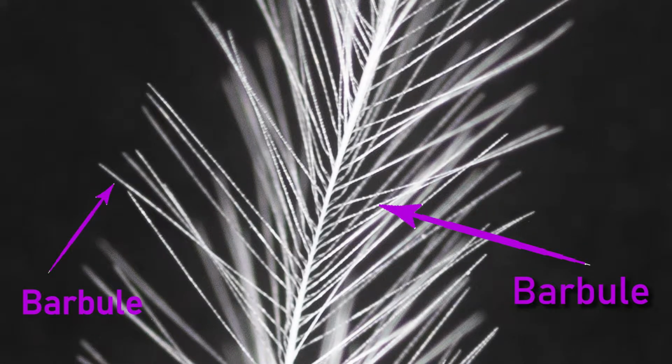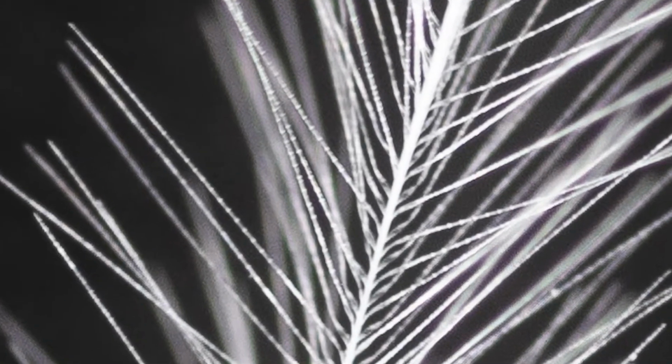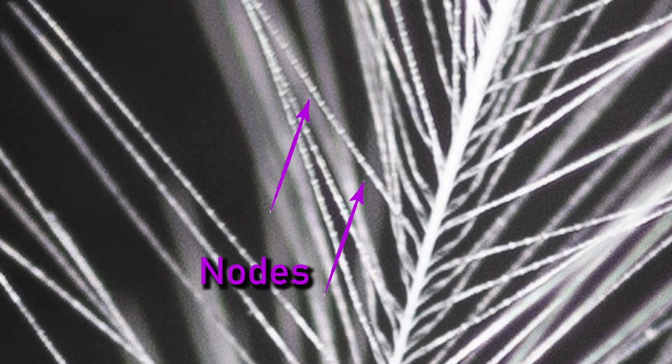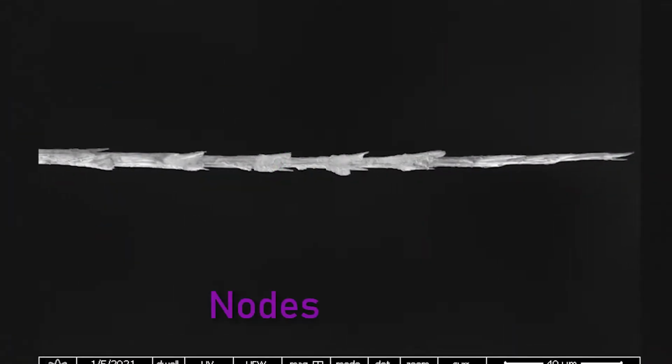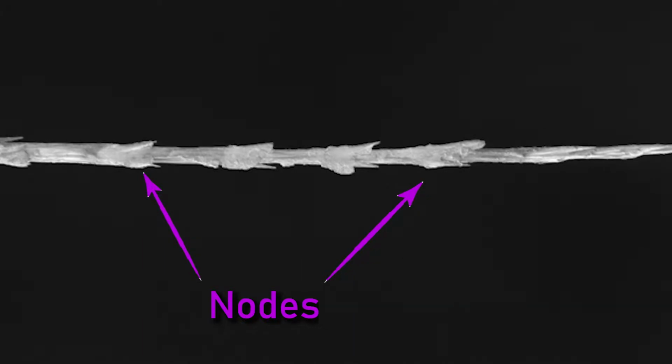If we look closer at the barbule, we can see bumps. And each one of those bumps are called nodes. In many birds, this is where pigment is located, giving the bird a color.